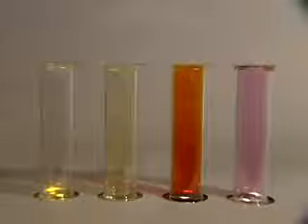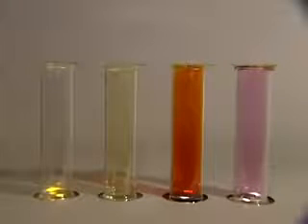Whether solid, liquid or gas, the halogen elements consist of diatomic molecules, F2, Cl2, Br2 and I2. Fluorine reacts, often ferociously, with almost everything else. A stream of fluorine instantly sets iron wool on fire, and it does the same thing to charcoal.